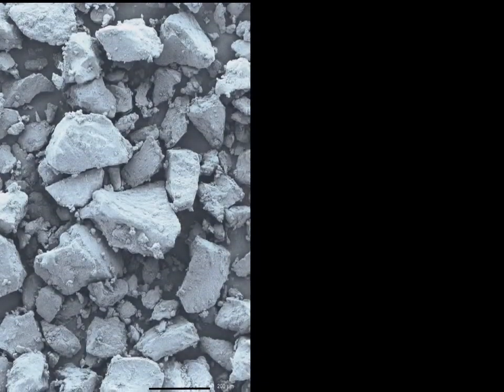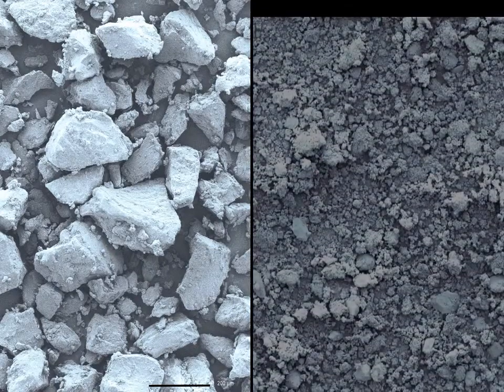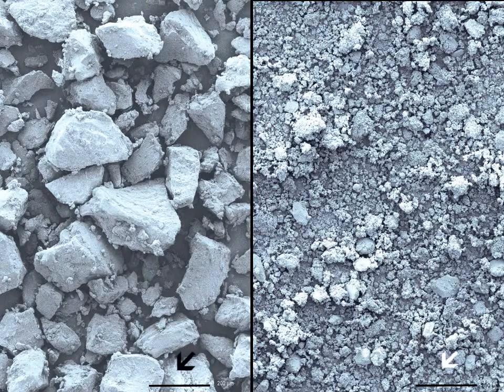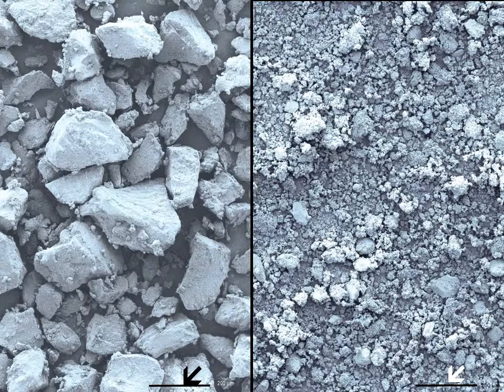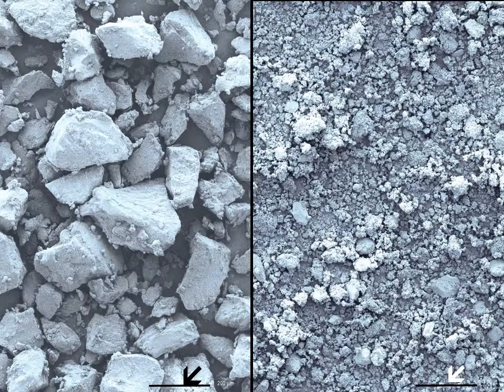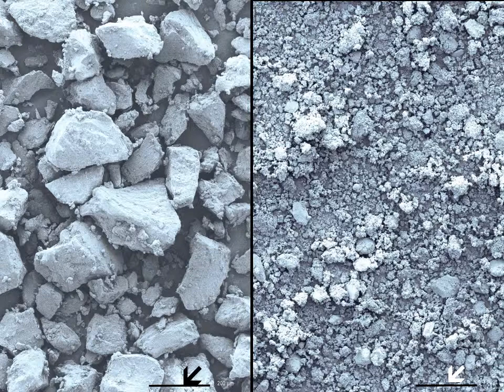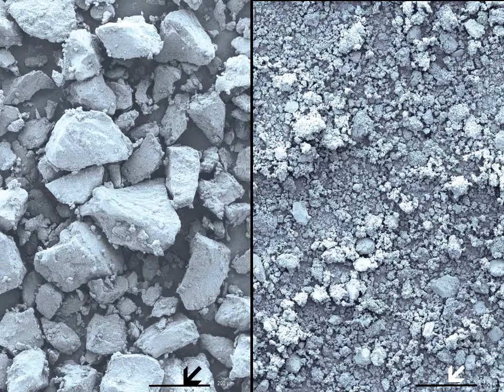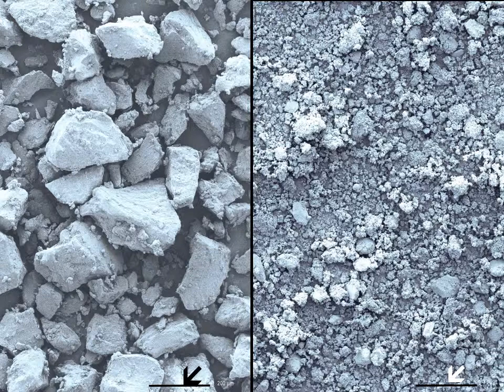Rice flour is sometimes also called rice powder. It is made either from non-glutinous or glutinous rice. Both kinds of flour are shown by scanning electron microscopy at the same magnification; the bars represent 200 micrometers, or two-tenths of a millimeter. The much coarser non-glutinous rice flour is used to make cakes, pastries, and noodles. The fine glutinous, sticky, sweet or waxy rice flour is used in desserts and dumplings and as a thickening ingredient in sauces.